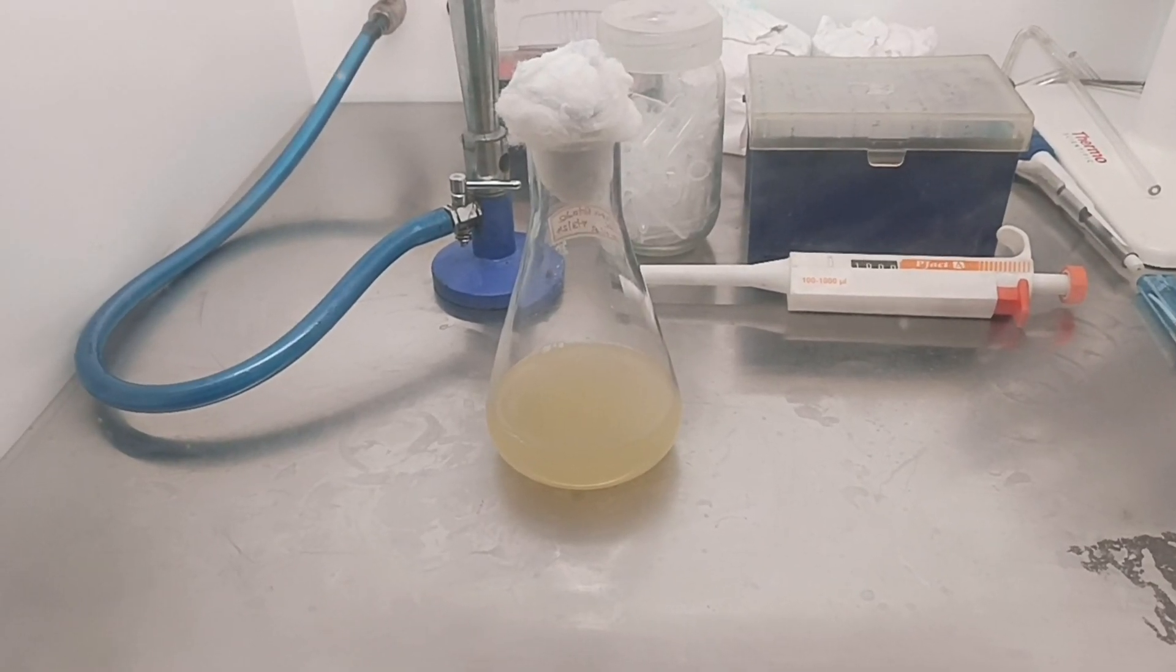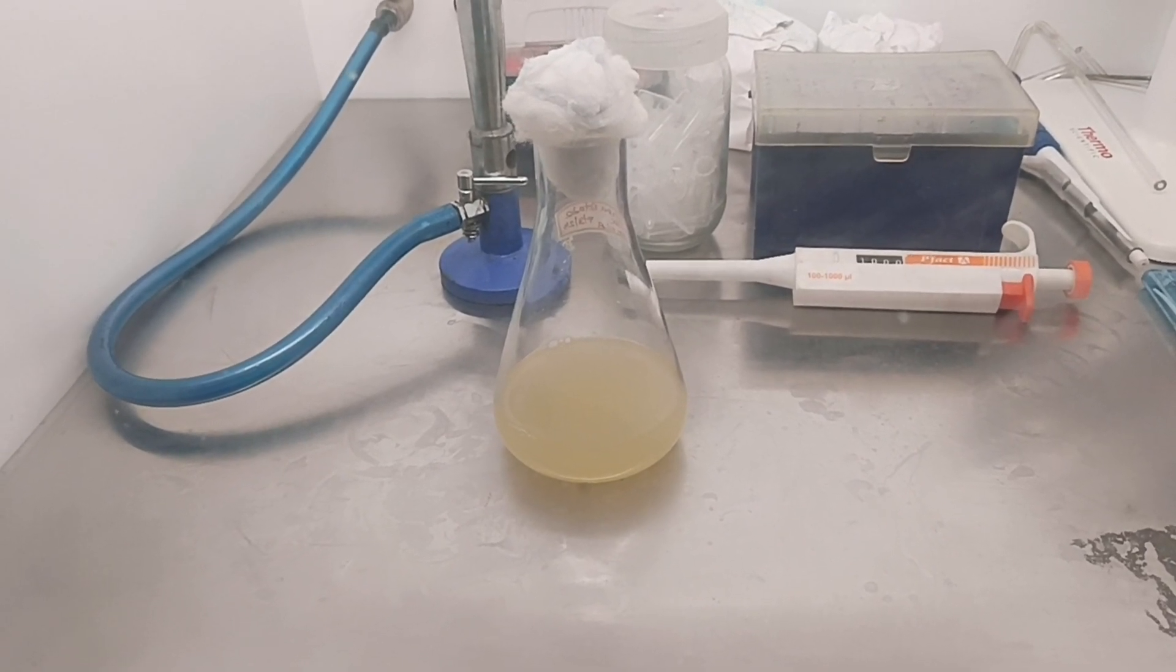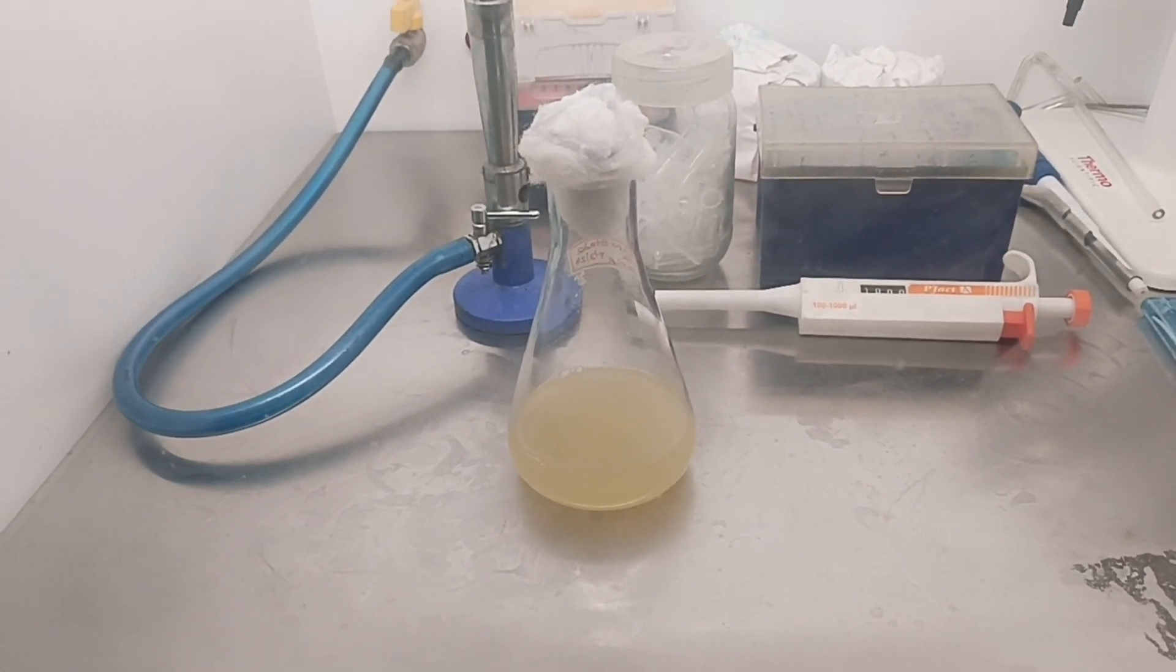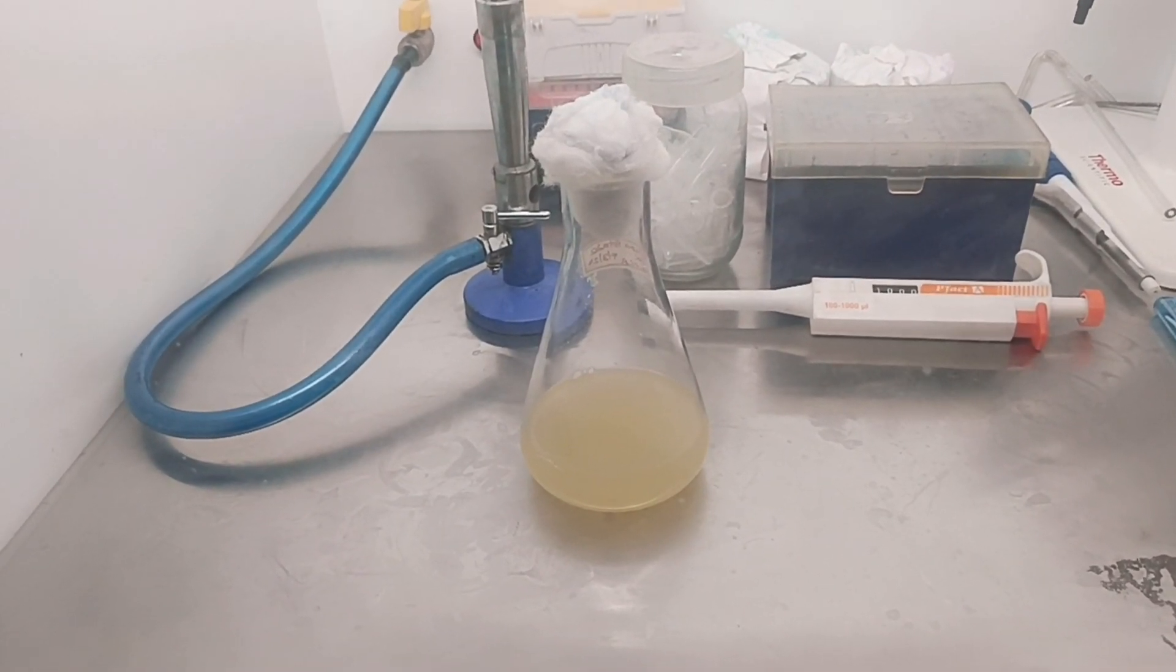Inoculate the bacterial colonies using a sterile loop into Luria-Bertani broth with any appropriate antibiotic and grow overnight shaking vigorously at 37 degrees Celsius.